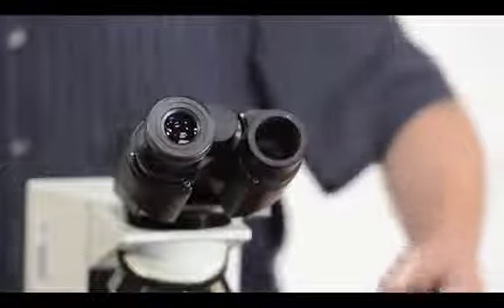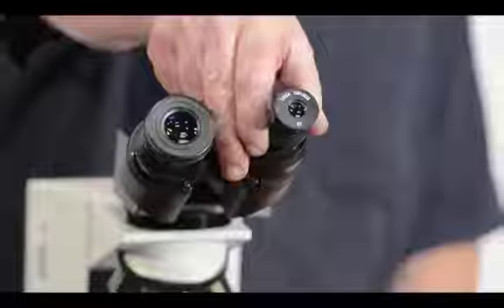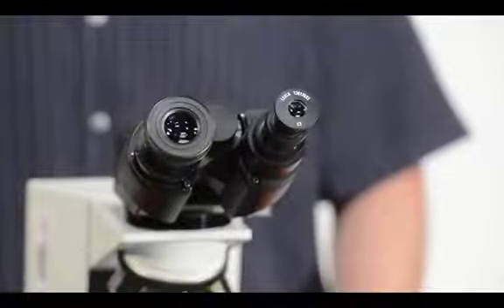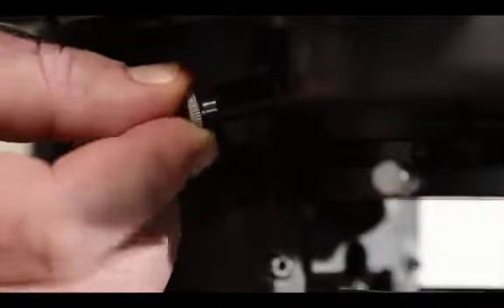remove the right eyepiece. Insert the phase contrast telescope where the right eyepiece is normally placed. We use the phase contrast telescope to help us visualize our alignment. If you look through the phase contrast telescope, you should see two rings. One is white and the other is black. Use the phase contrast adjustment screws to position the white ring directly above the black ring. This takes some practice, so work patiently and carefully. If you have any questions, please ask your TA.